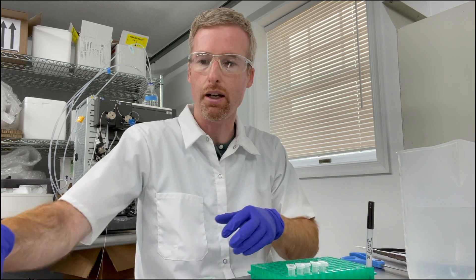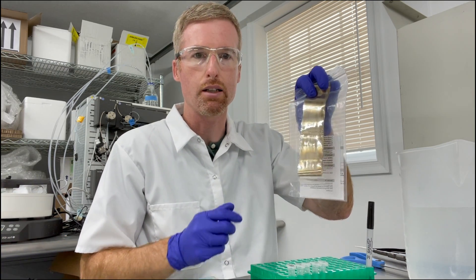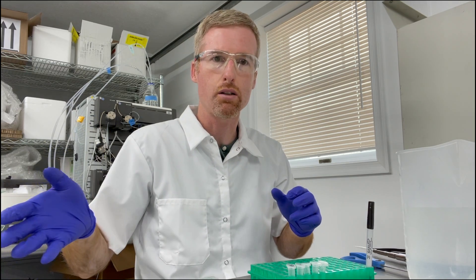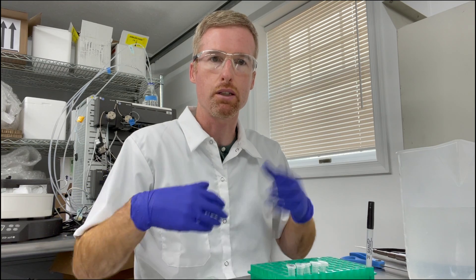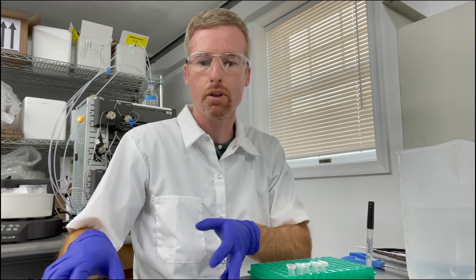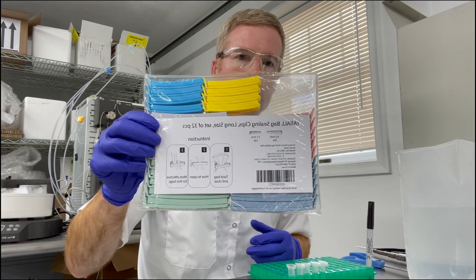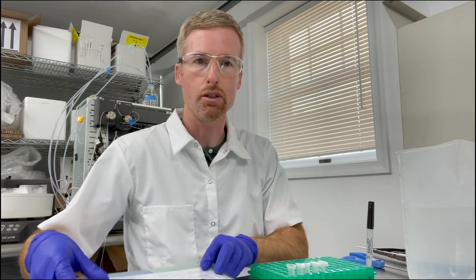And to do that I have regenerated cellulose dialysis tubing. This is a smaller molecular weight cutoff than the protein so it'll keep the protein in but let buffer diffuse back and forth across the membrane. I've also got some bag sealing clips. These you can get on Amazon. They work pretty well, I've been using them a long time.